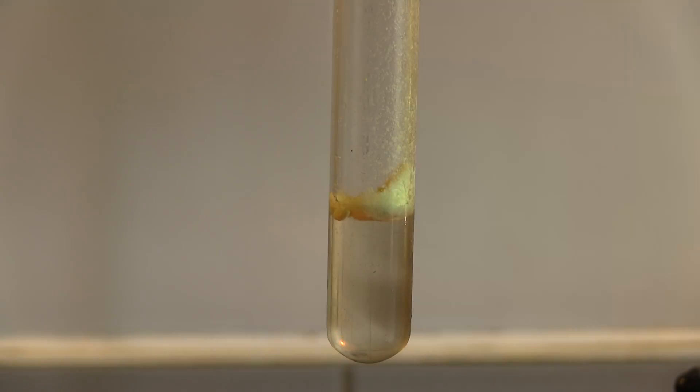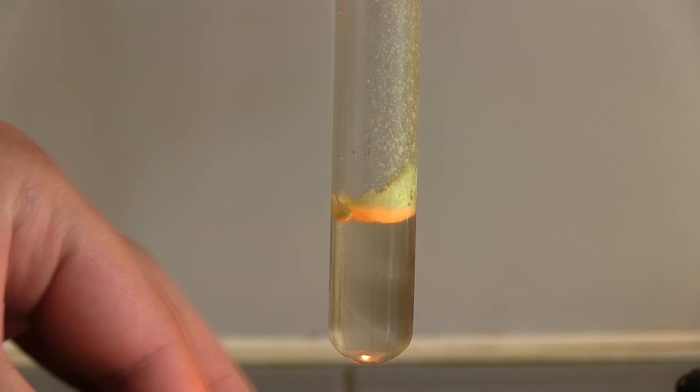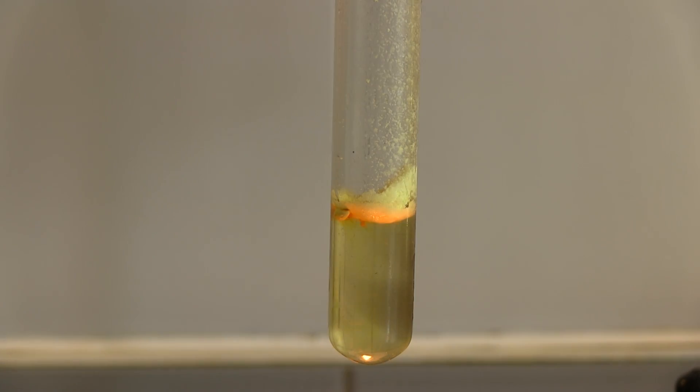Then, in this sped up footage, I'm adding sulfur in three portions. When no more sulfur dissolves, I add some potassium hydroxide in the solution to make sure everything dissolves, and the potassium hydroxide is in abundance.